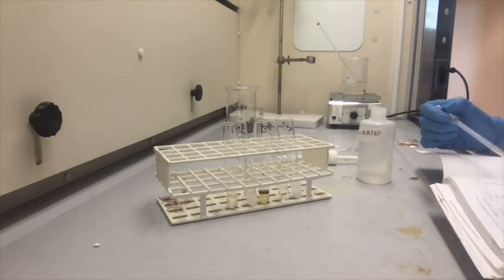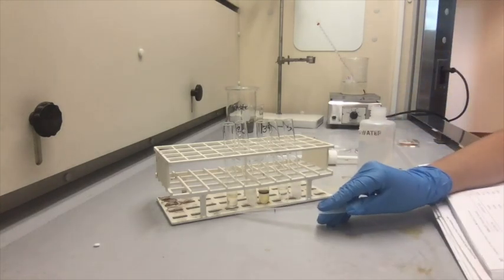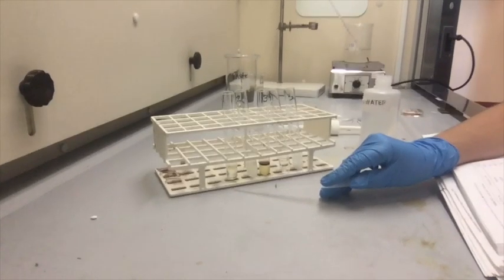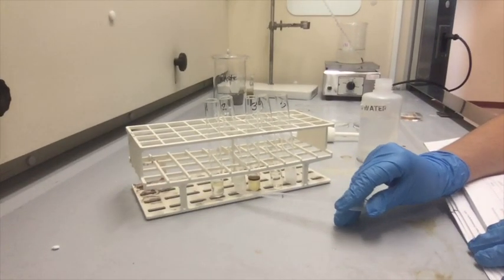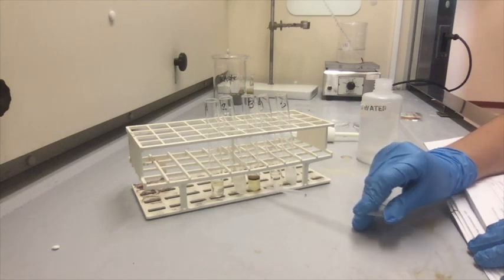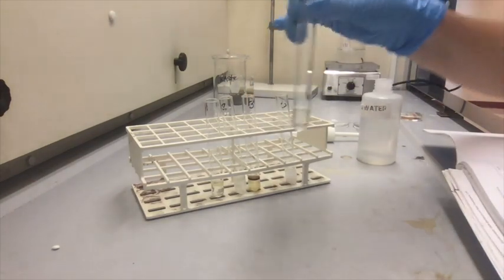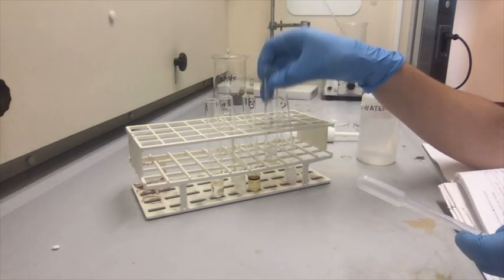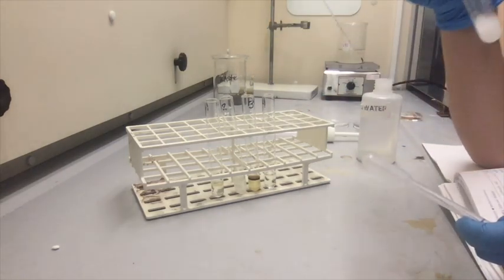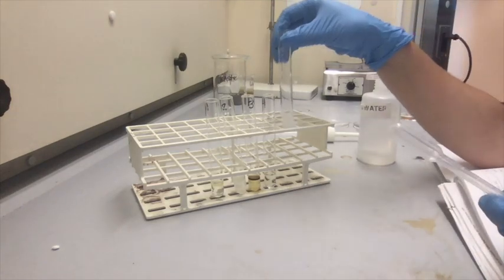Note that there's a layer on the top of the water in each test tube. So as you can see, or maybe you can see, bring you a little bit closer. So yellow and clear, there's a cloudy and more clear, brown and a little bit yellow. This one, they're both clear, so it's really hard to see, but the top layer is there, so there's 2 layers. And this one, we might have to let that sit for a little bit.